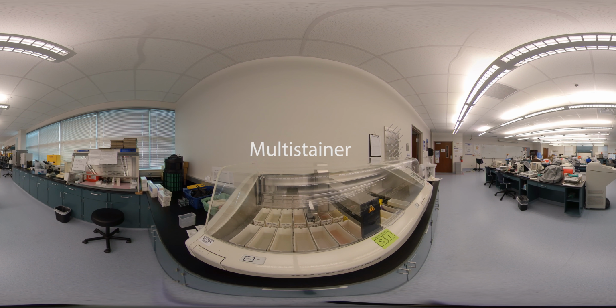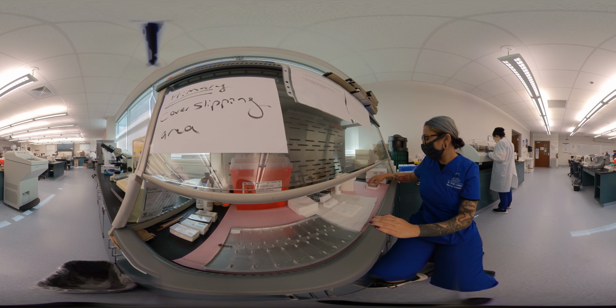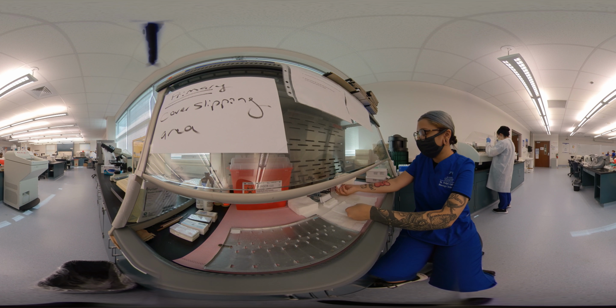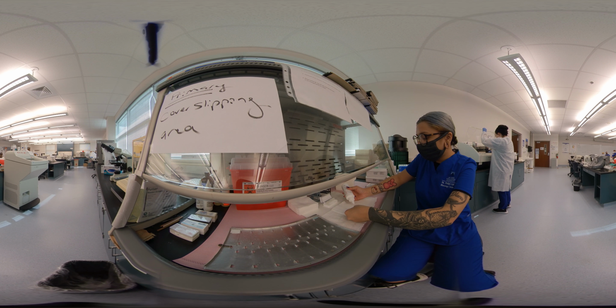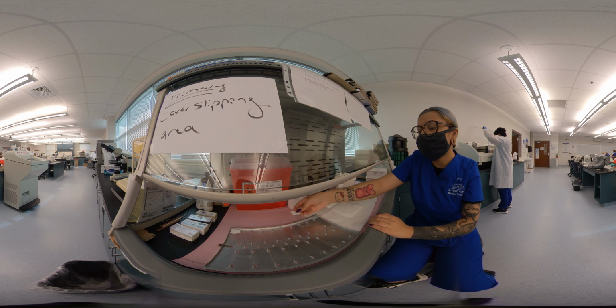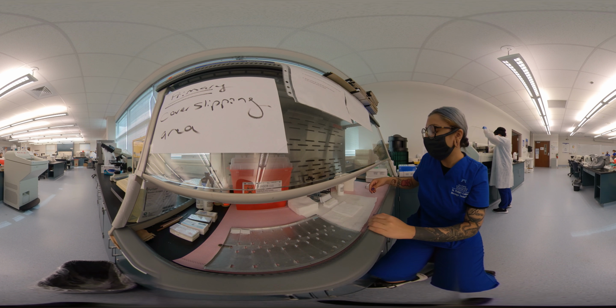Once the multi-stainer is done, the slides will get cover slipped. The process of cover slipping is taking another piece of glass and placing it on top of the tissue that's on the slide. This preserves the stained tissue and allows the pathologist to see the tissue clearly under the microscope. Now the pathologist is able to view the slides.